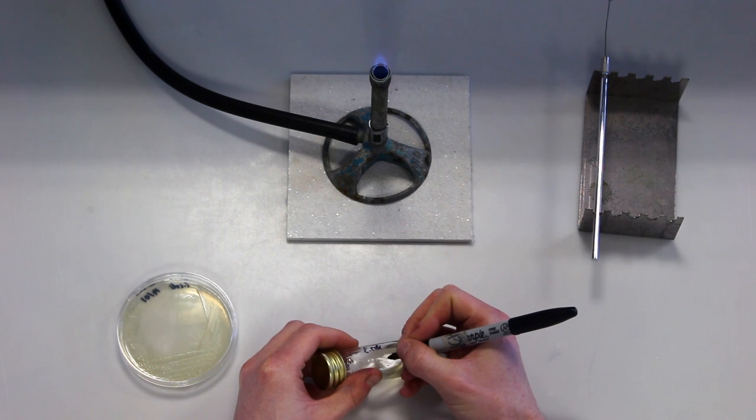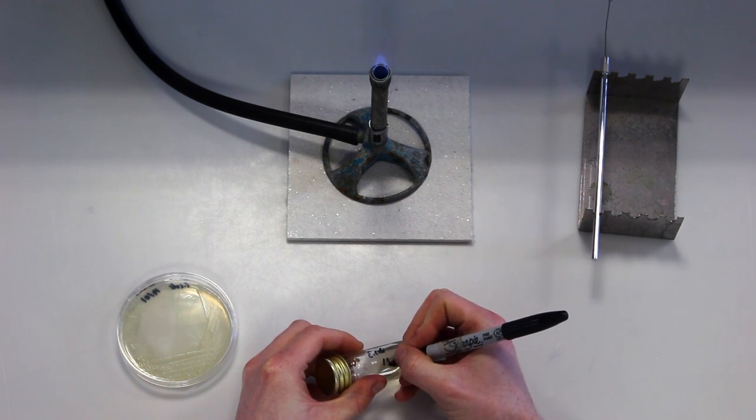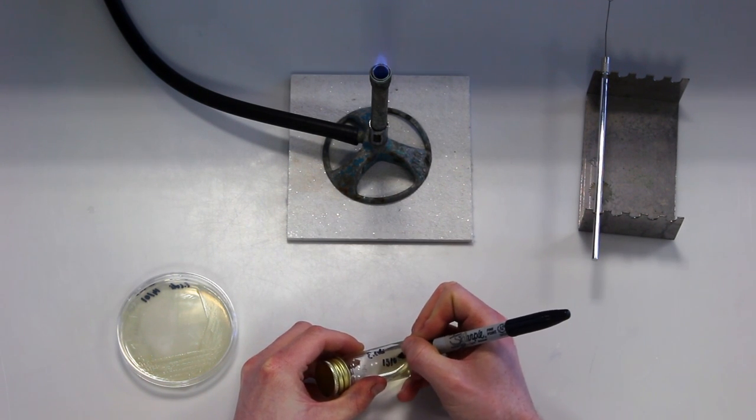The broth container is first labelled with the information previously described and its top loosened.